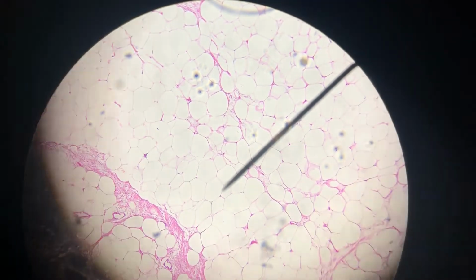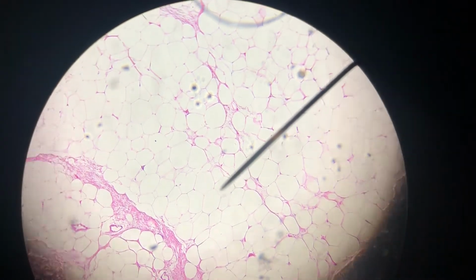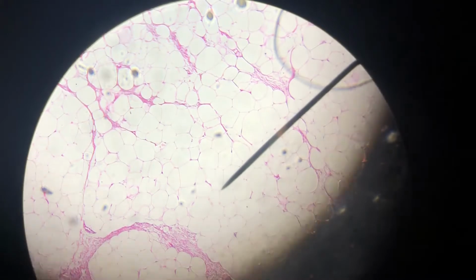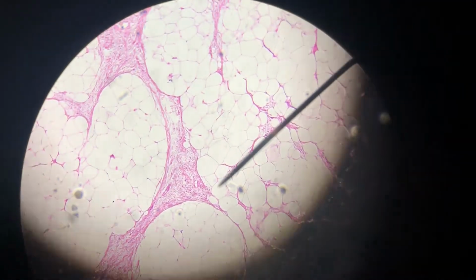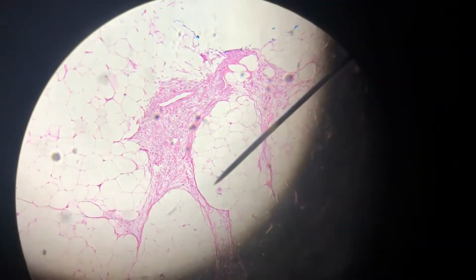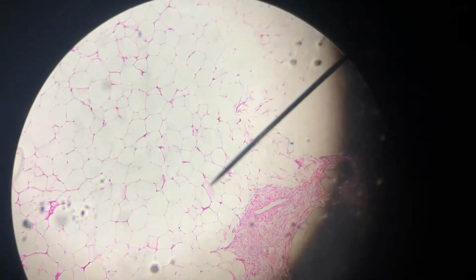Oh, that's pretty good. So you might look at that and say, oh, that's a simple squamous epithelial tissue, but it's not. This is adipose connective tissue, and those are adipocytes. These little dark pink spots are their nuclei all clustered to the side. There are fibroblasts in here too that are secreting some matrix that's very similar to areolar connective tissue. So that's the other stuff we got going on in here. But that's adipocytes and adipose tissue.